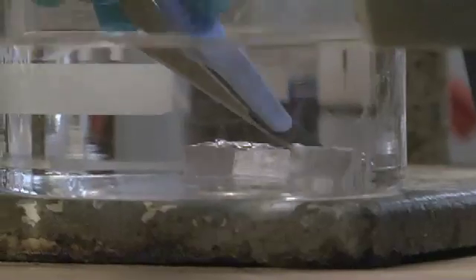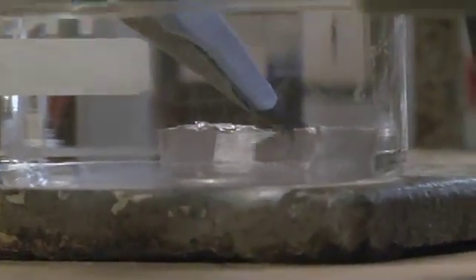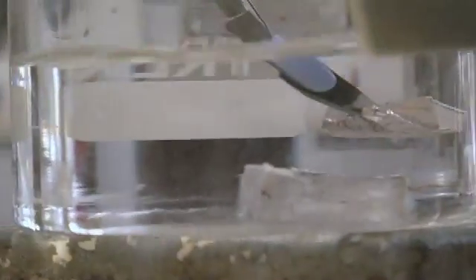So the thing is, when we dissolve the sodium up in this, it's going to get quite hot. So we don't want to add too much at any point, because otherwise we could come undone. So if I cut it up, I've just broken my scalpel. Oops! That is not good.